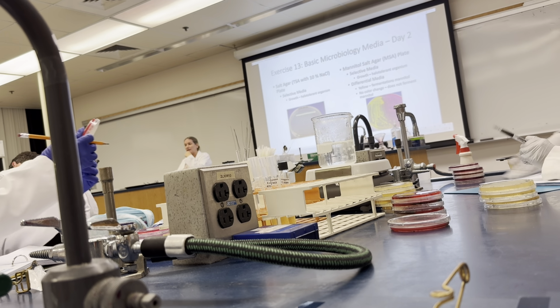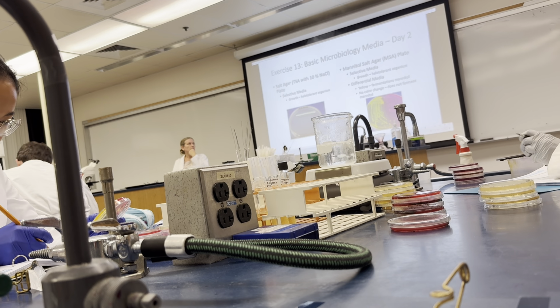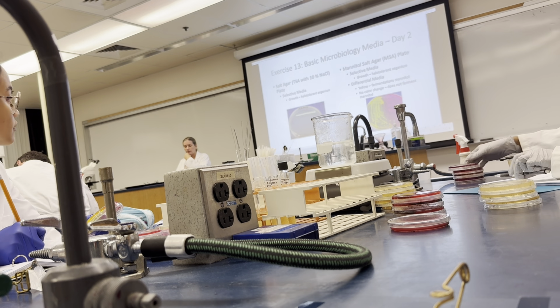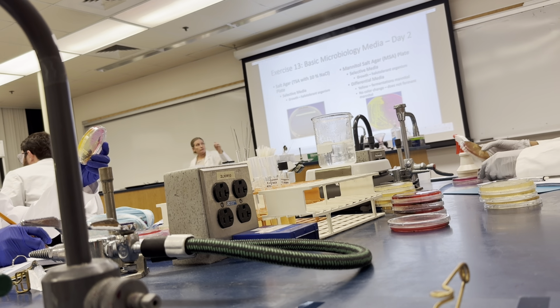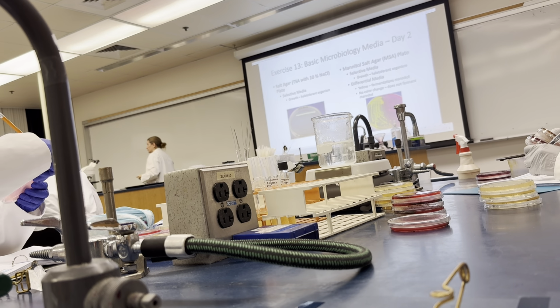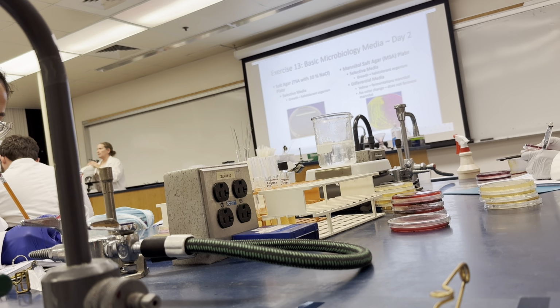Which organism ferments mannitol? Staphylococcus aureus. And Staphylococcus epidermidis does not. Okay? So again, anytime you have two components like that, selective media and differential media, there's two bits of information, right? Does it grow or does it not grow? And then the second is, does it then do that particular activity or does it not do that particular activity? In this case, ferment mannitol, yes.